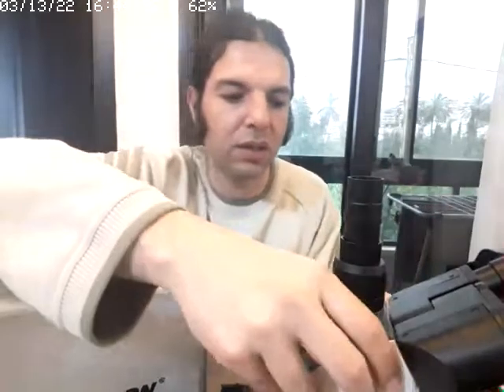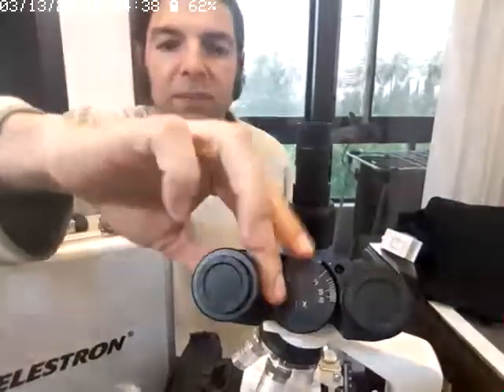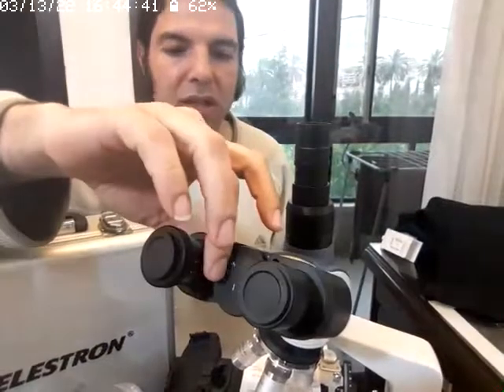Because I'm a telescope fan and I have a lot of eyepieces for telescopes, I started investigating whether I can use telescope tools and gadgets on the microscope. When I bought this microscope, it's a trinocular, so I can install here and over those two sides. I can use this because this is a binocular, and I can rotate it the way I like.